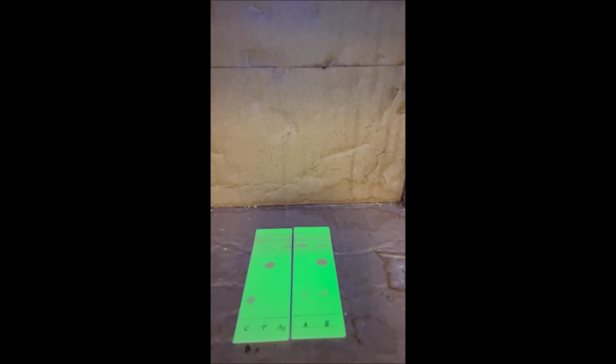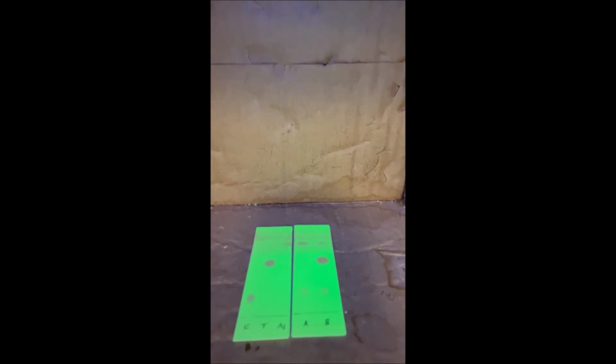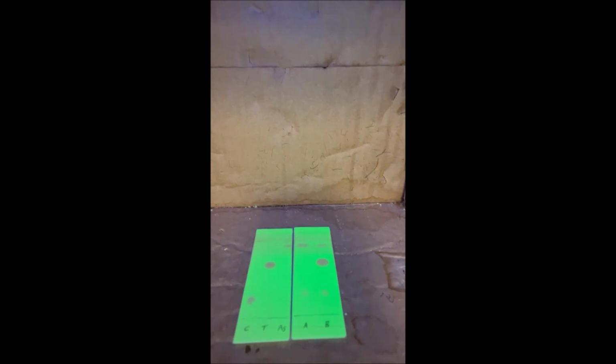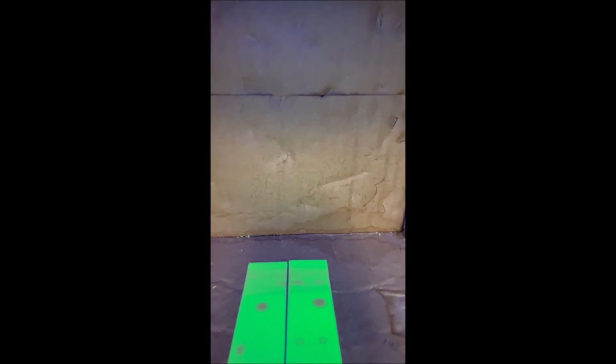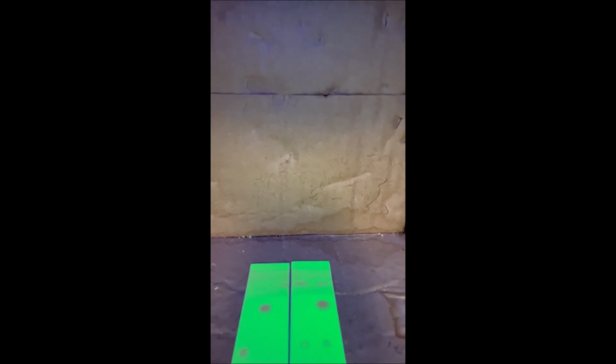So what we're gonna do is, this video is just so you guys can see what these plates look like. And ordinarily what you guys would do at this time is circle all these spots and then do some measurements. Now obviously you guys can't circle those because this is a video. I'm gonna circle these spots, and then I'll show you what the plates look like afterwards. But this in essence is thin layer chromatography. The spots have moved from where they were before.